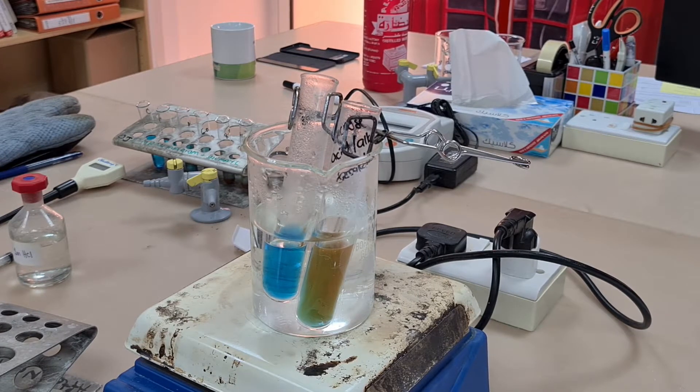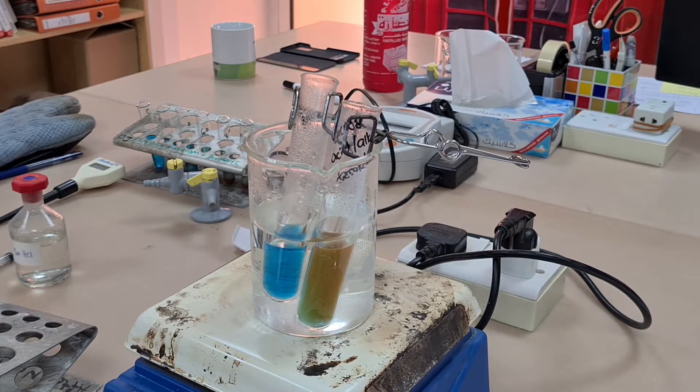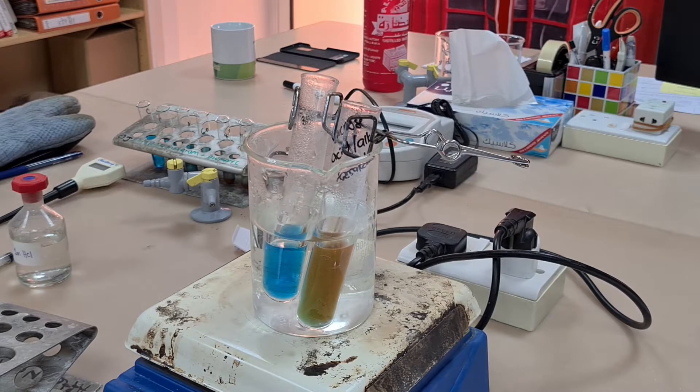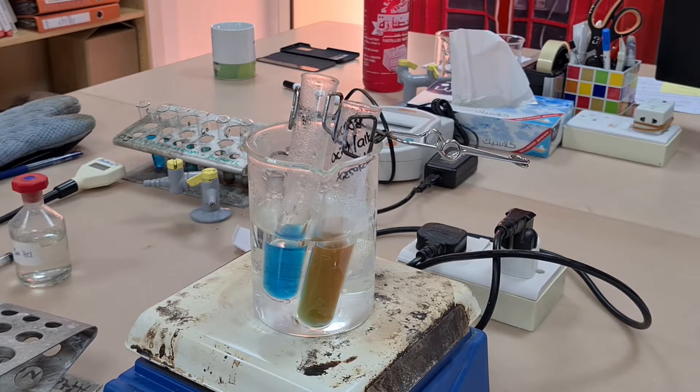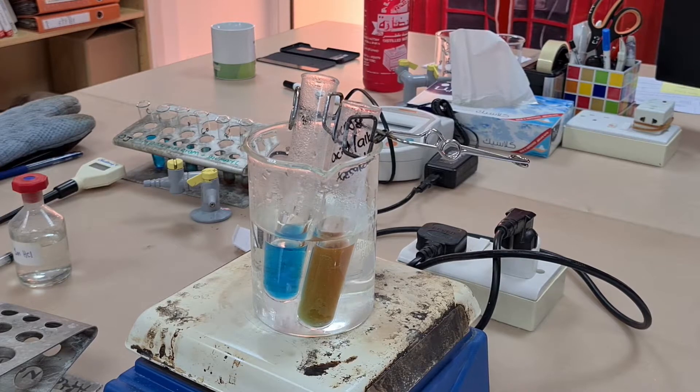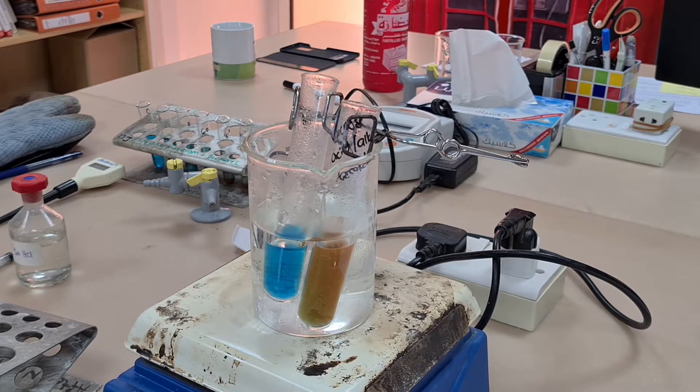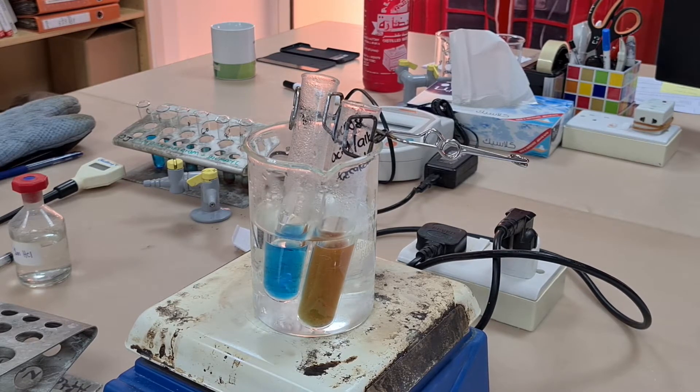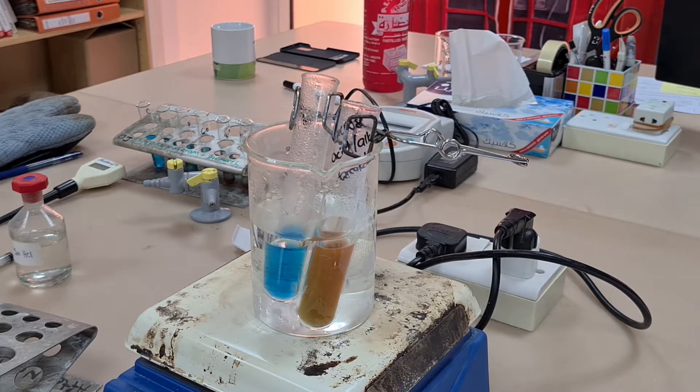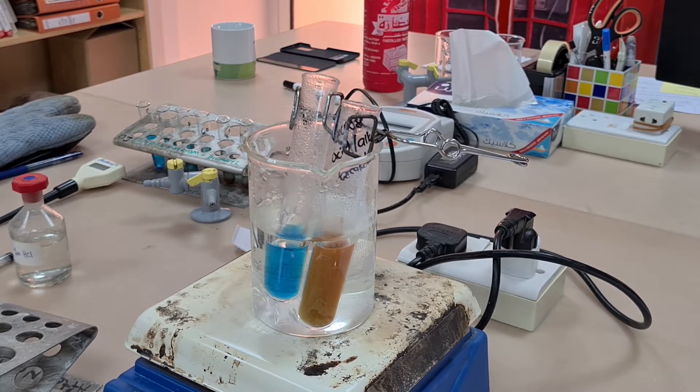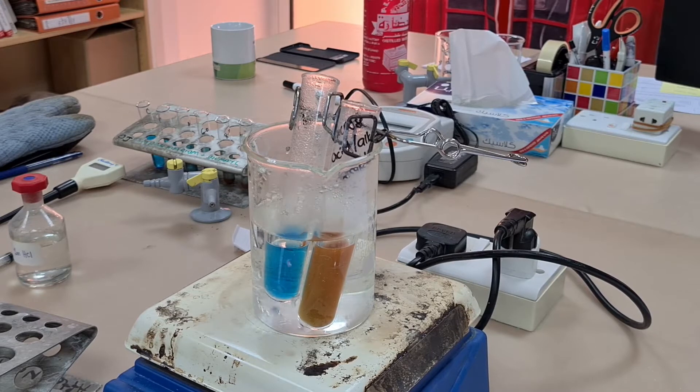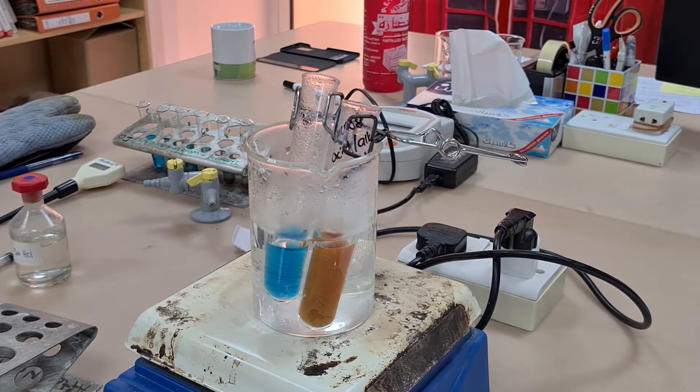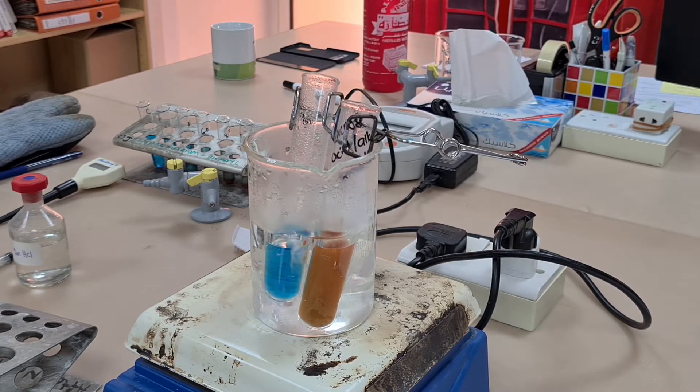However, in actual fact this test is semi-quantitative because we can tell by the degree of color change how much reducing sugar the solution contains. This video is operating at normal speed, so you can see just how quickly that color change takes place. It continues to change from blue to a brick red color within about three minutes.